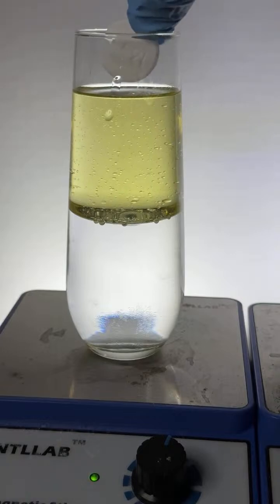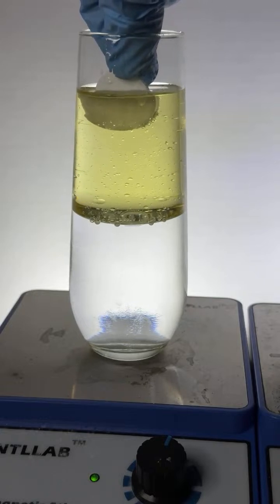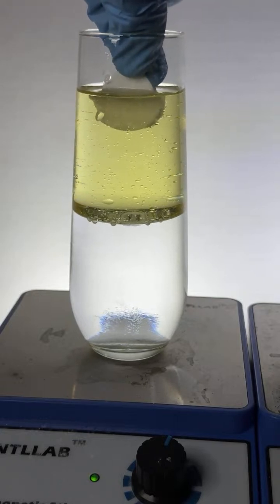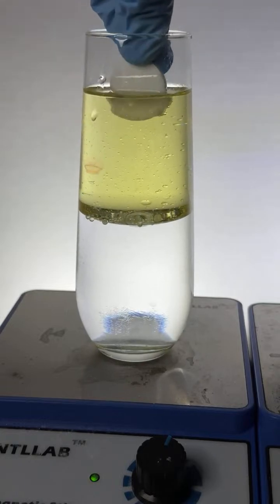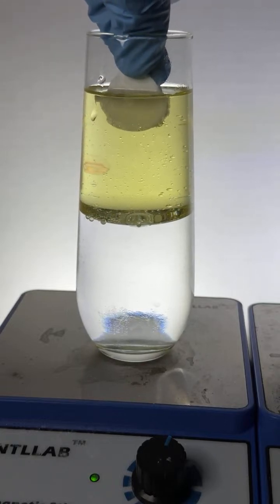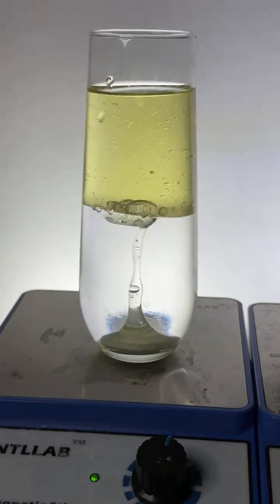Here we go. Up here at the top, into the oil. It's interesting. It doesn't notice it. Oh, actually, it does. Look. You can see a little bit of gas forming. You see it? So a little bit of it does react with the oil. I wonder if that's oil or residual water. Anyways, let's just drop it in and watch it go.